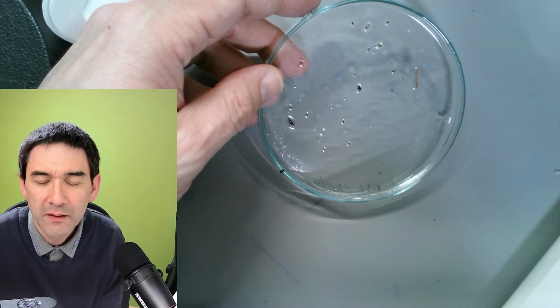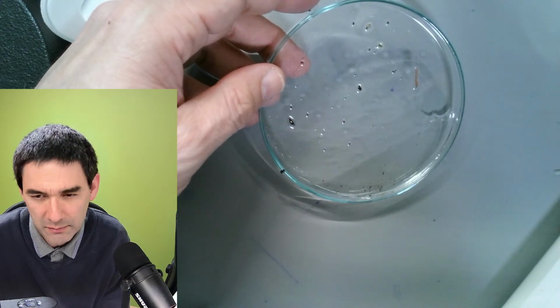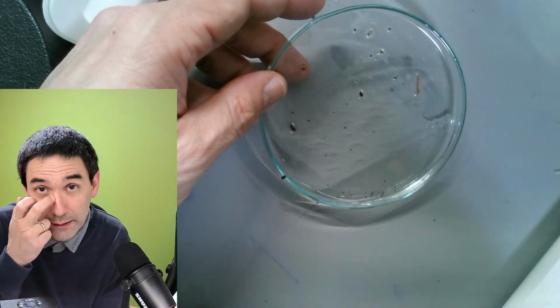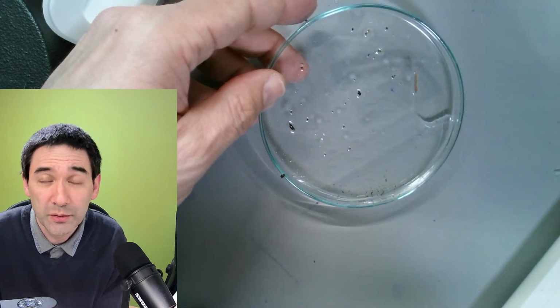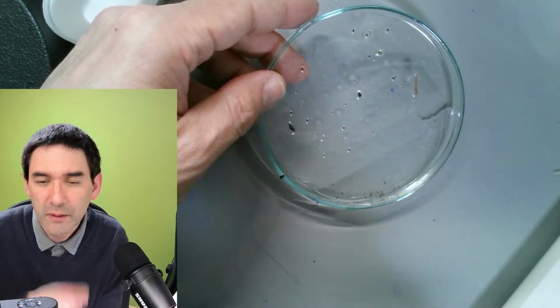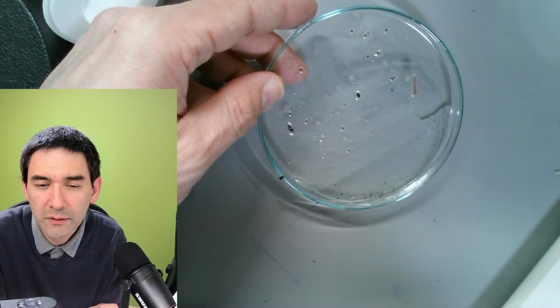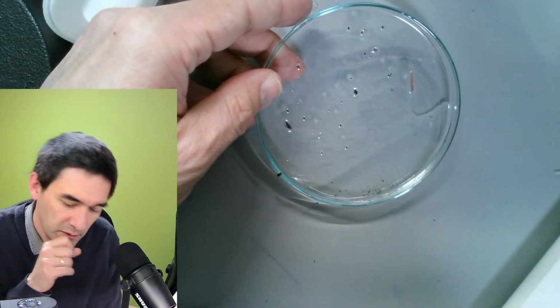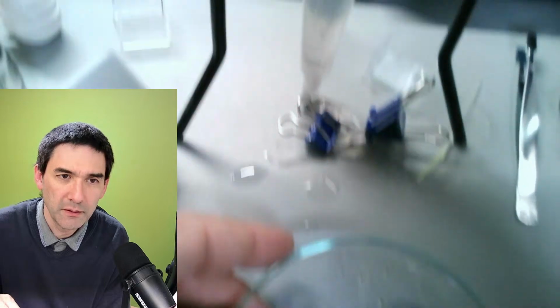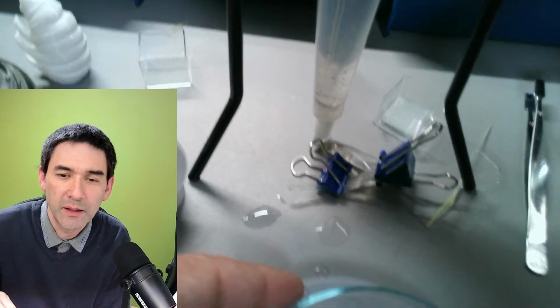Yeah, maybe a separatory funnel the chemists use. They're of glass. Yeah, that would be a possibility. I see what you mean. Okay, that's the one used for separation. Maybe a small one. Yeah, use the small finger of a rubber glove. Oh, that's also an interesting thing. The finger of a rubber glove is flexible enough that you can actually press it and close it off.